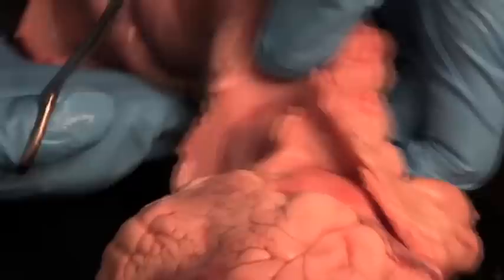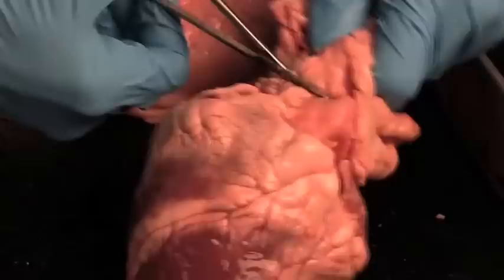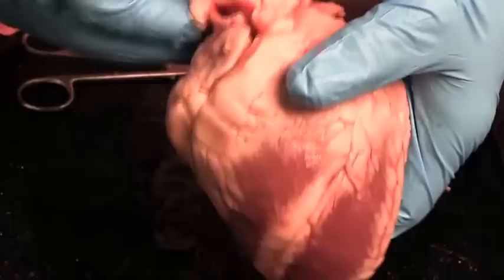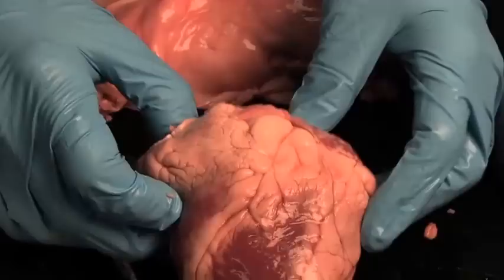This is about the same size as your heart, by the way. There's a little bit of extra tissue on top here that we can get rid of — we can just trim some of this off to make it a little easier. There, we can just throw that out, and now it's a little easier to see the plumbing of the heart.